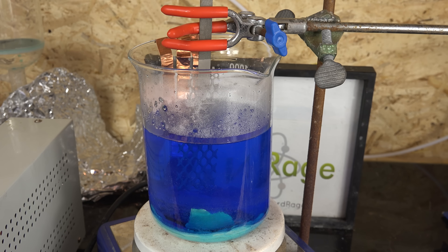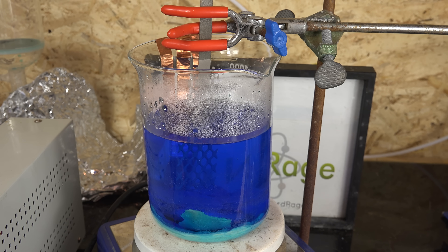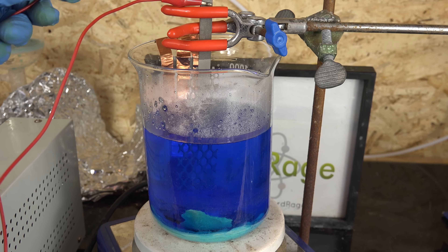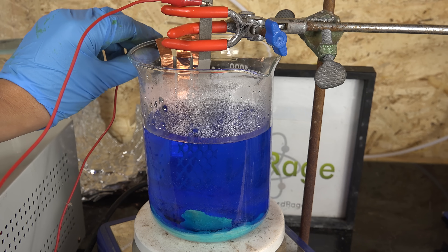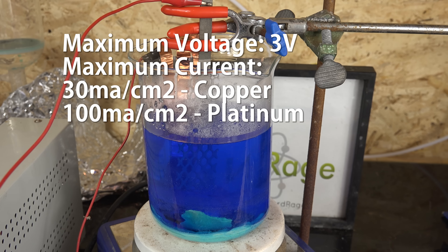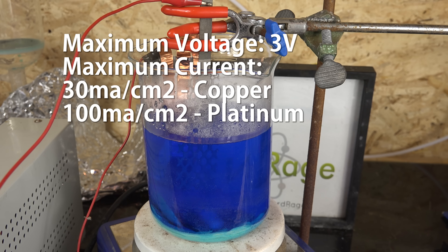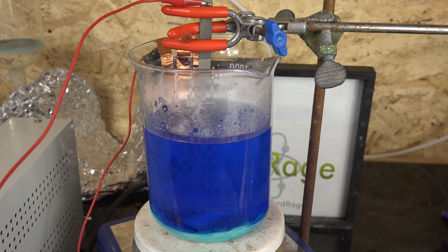I'm using a platinum coated titanium anode. You don't want it too close to one piece of copper electrode because that will cause an uneven current distribution. Platinum electrodes are not too hard to find and platinum coated titanium electrodes can be bought online. Just be aware there are a lot of fakes out there, so you'll need to go with a reputable seller and not some cheap knockoff on eBay. Once it's secure, we hook up the power leads and connect the electrolytic cell to a variable power supply. The copper electrode is given a negative charge and is our cathode. The platinum electrode is given a positive charge and is our anode. Set a maximum voltage of about 3 volts and a maximum current corresponding to 30mA per square centimeter of exposed copper, or 100mA per square centimeter of exposed platinum, whichever one is smaller.